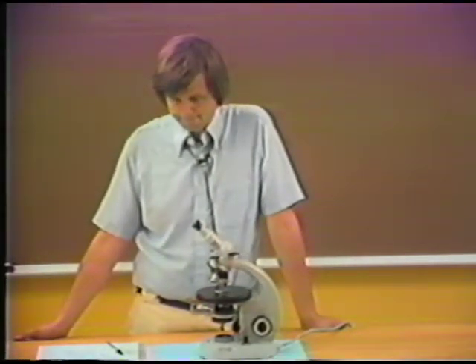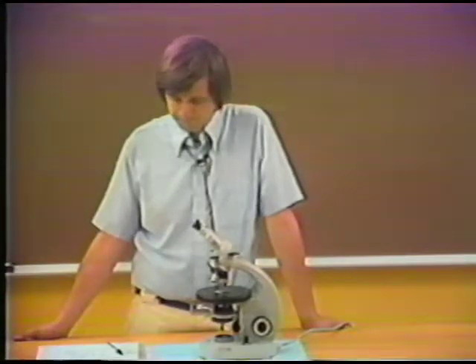You can measure this angle with your stage by rotating the stage from having it parallel to the crosshair for one of the cleavage forms, and then moving the stage around until the other cleavage form is parallel to the crosshair, as I'm demonstrating for you now. So this angular relationship in this particular case is very close to 90 degrees, is diagnostic of a pyroxene, and certainly serves to distinguish it from another common similar appearing mineral, the amphibole group.